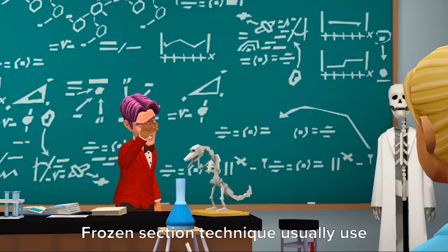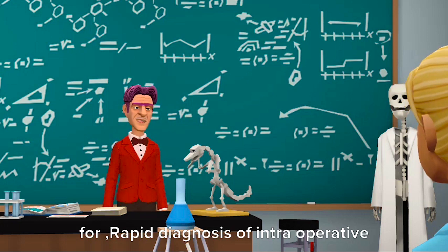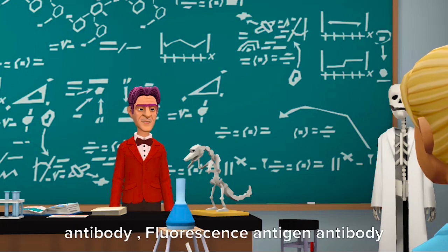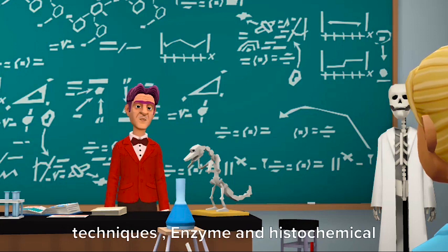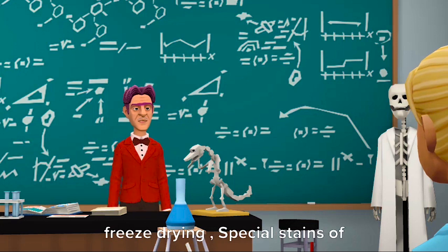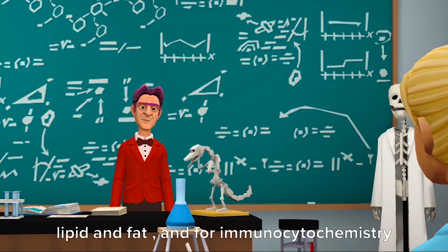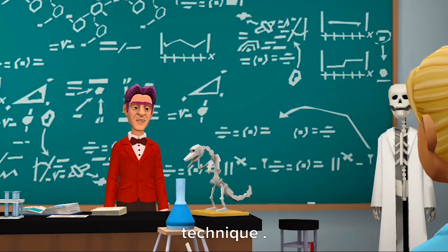What are the applications of Frozen Sections? The Frozen Section technique is usually used for: rapid diagnosis of intraoperative biopsies, demonstration of antigen-antibody and fluorescence antigen-antibody techniques, enzyme and histochemical investigation, autoradiography, freeze drying, special stains of neural tissues, demonstration of lipid and fat, and fluorescence cytochemistry techniques.